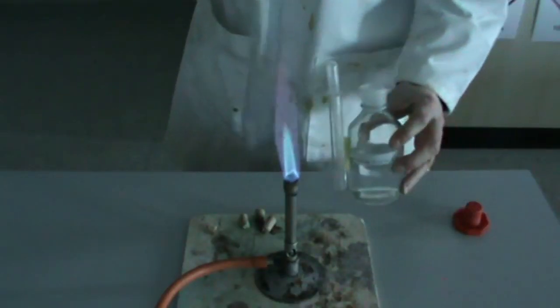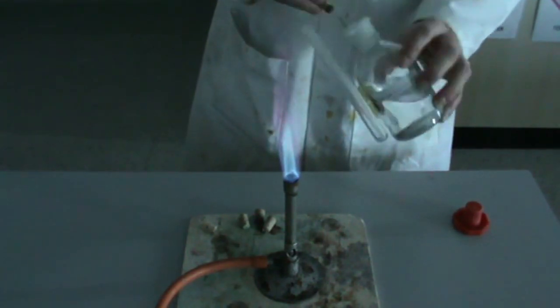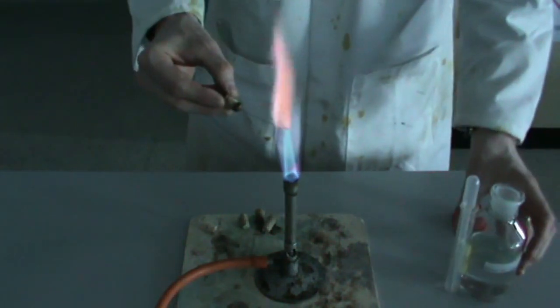Next, potassium chloride. Nice lilac purple.